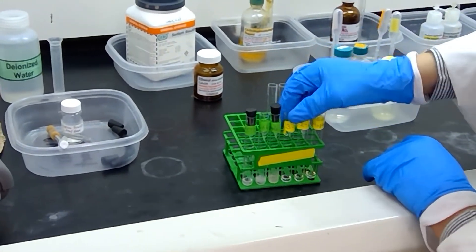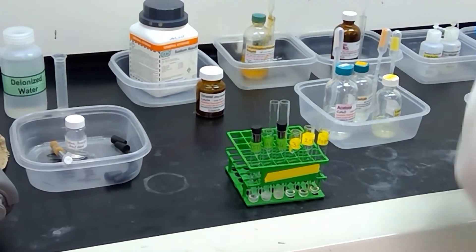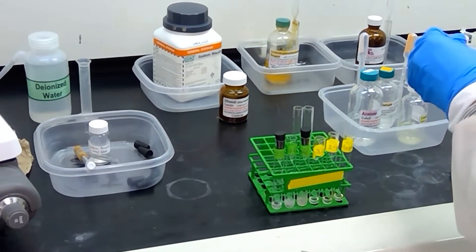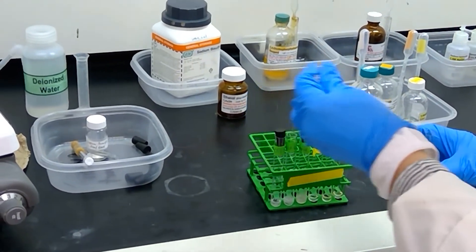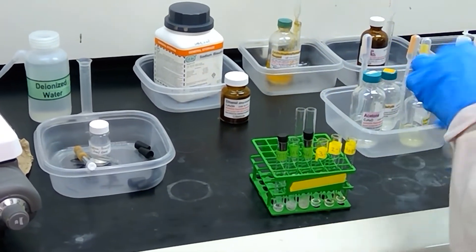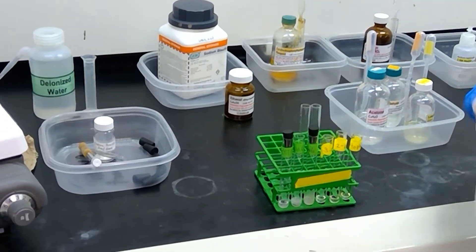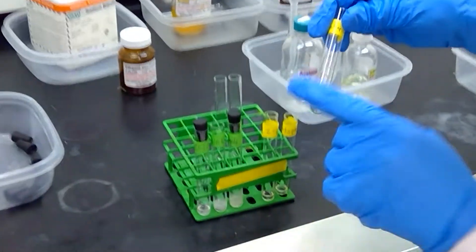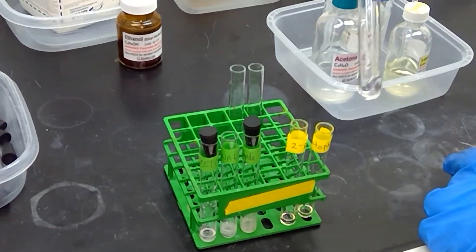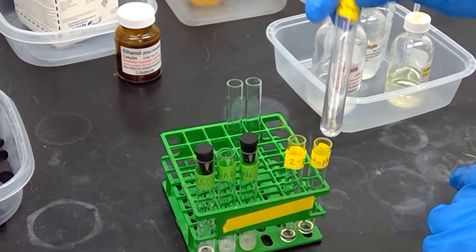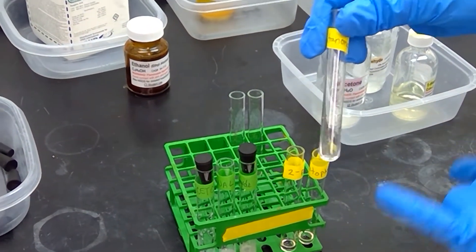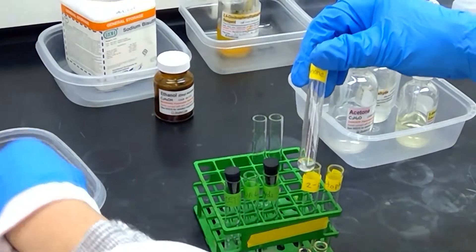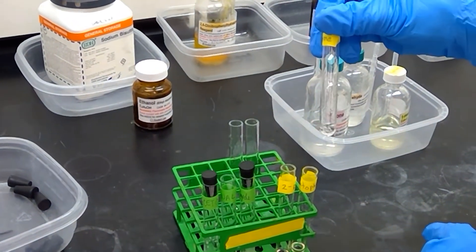Next up, we will move on to the sample 3-pentanone. And let me open up my bottle of 3-pentanone. Okay, so I added about four drops of 3-pentanone. And it looks like 3-pentanone isn't giving us anything just yet. It might be like acetone, we need to wait a few minutes. So I'm going to go ahead and stopper it and see if we get anything in a few moments.